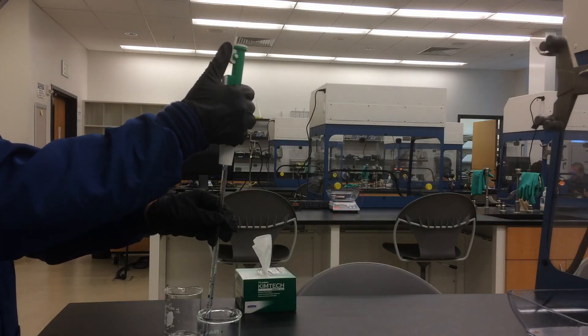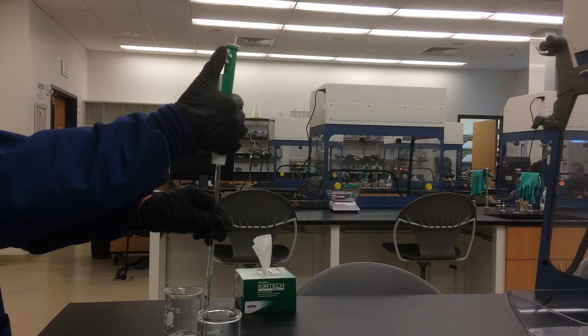Let's say you want to transfer a full five milliliters of solution.